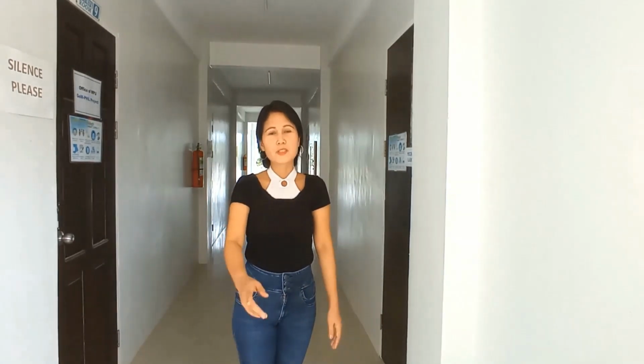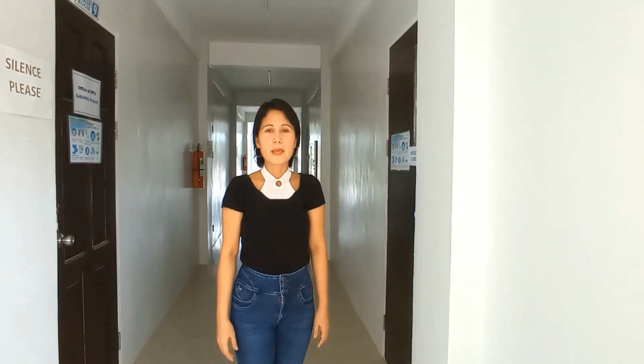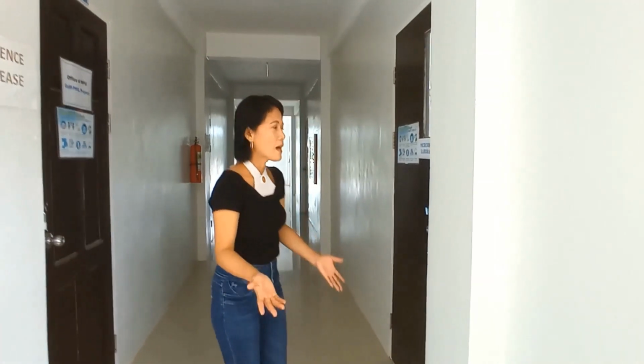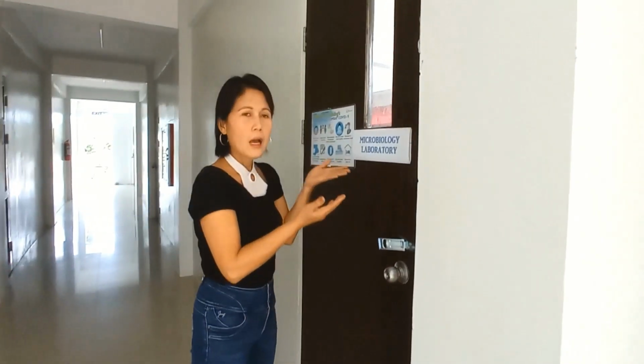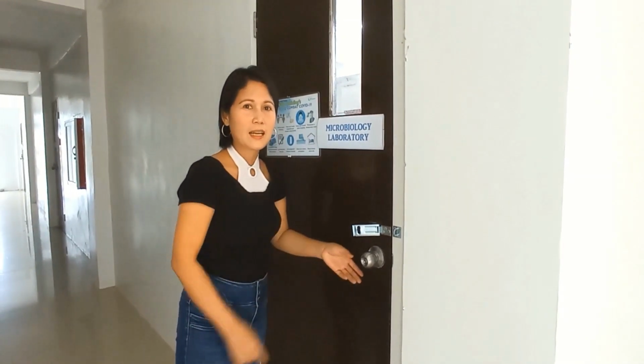So, let me bring to your doorstep, or not to your doorstep, but to your screen, the laboratory of the Western Philippines University. So please come to our Microbiology laboratory. This is my laboratory.